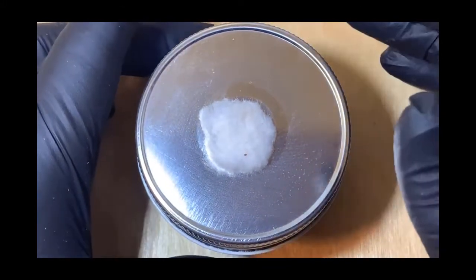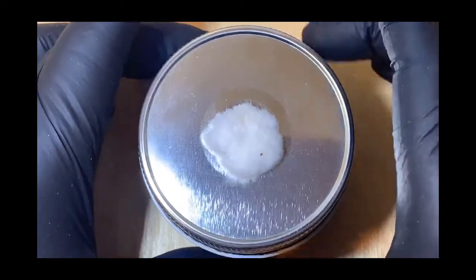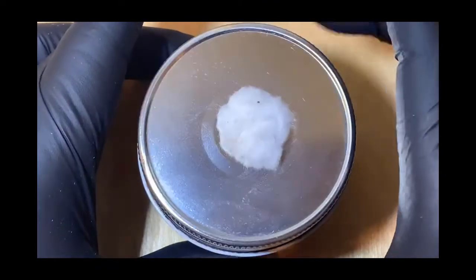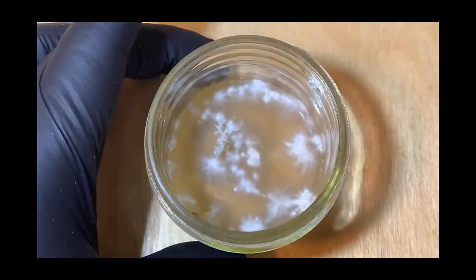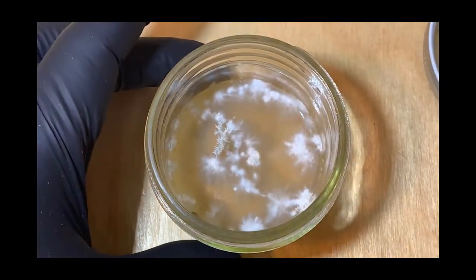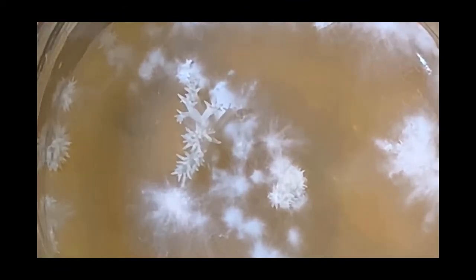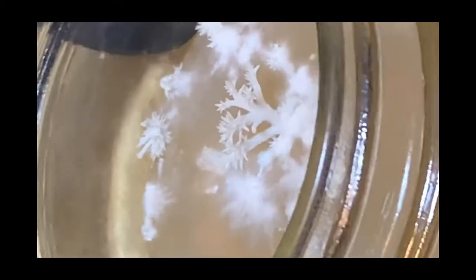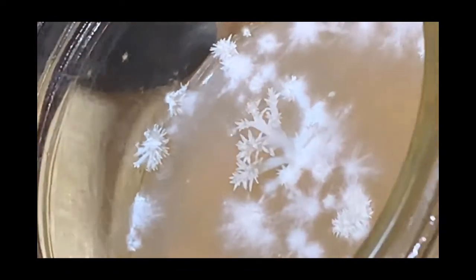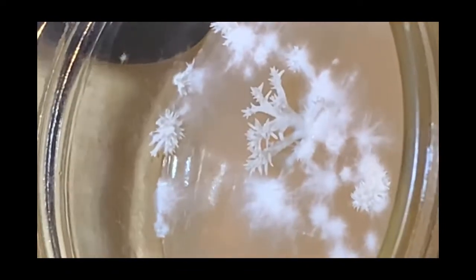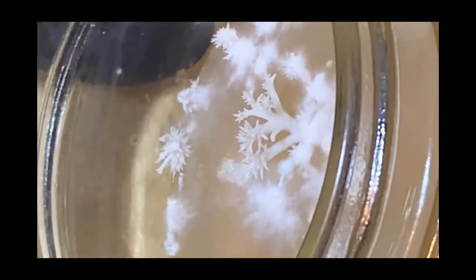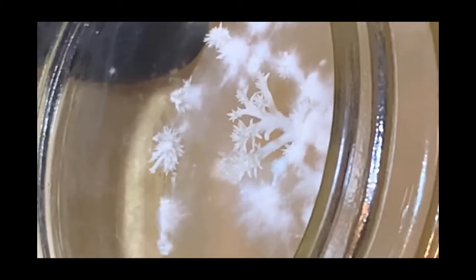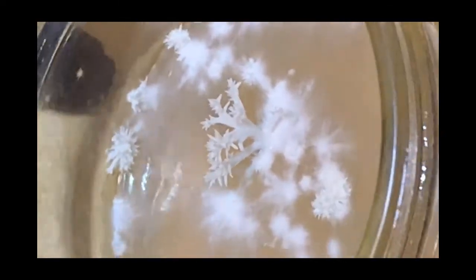Sorry about that. This is lion's mane mycelium. And the surprise is the growth of the mycelium up into actually a fruiting body structure. Lion's mane loves to fruit, and that's kind of obvious.